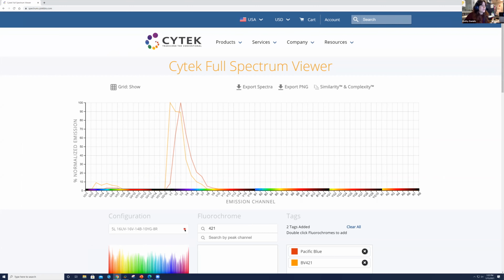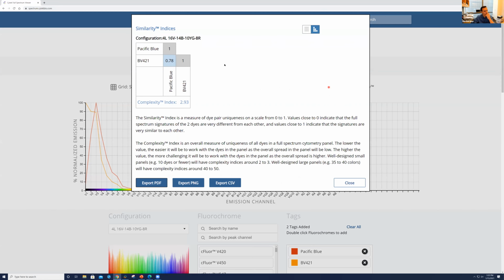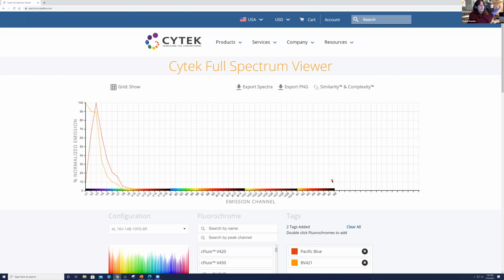Yeah, right. So if we change this configuration, it absolutely will change based on the excitation sources that you have on the unit. So for example, if we change it here to a 4 laser, this is going to look a little bit different. And if we click on the similarity, I believe that value might potentially be slightly different as well, based on the lasers that we have on the unit itself. Mm-hmm. Yeah. So it's tailored for the Aurora. Right. Yes. Yep. Okay.